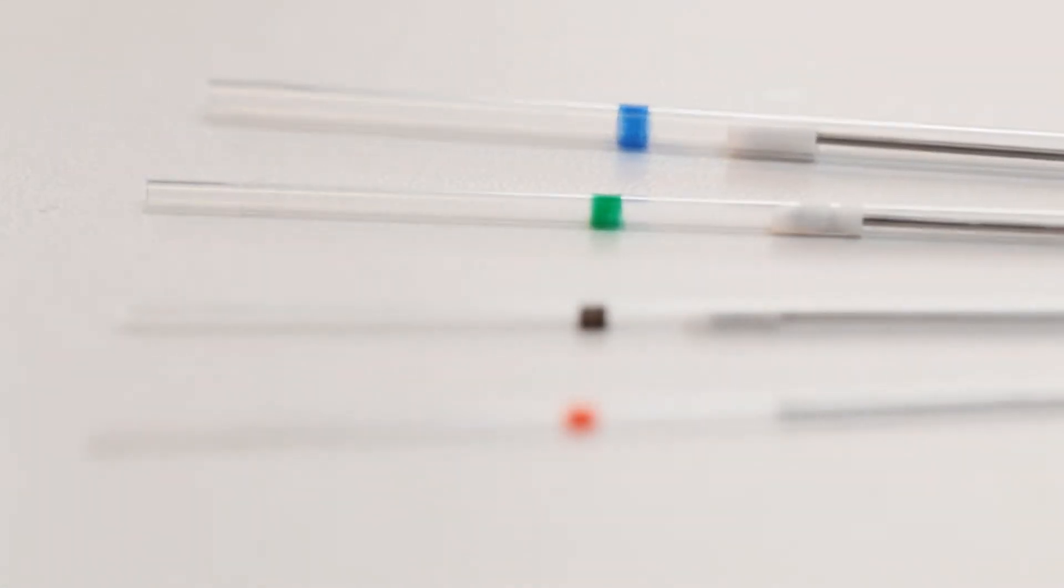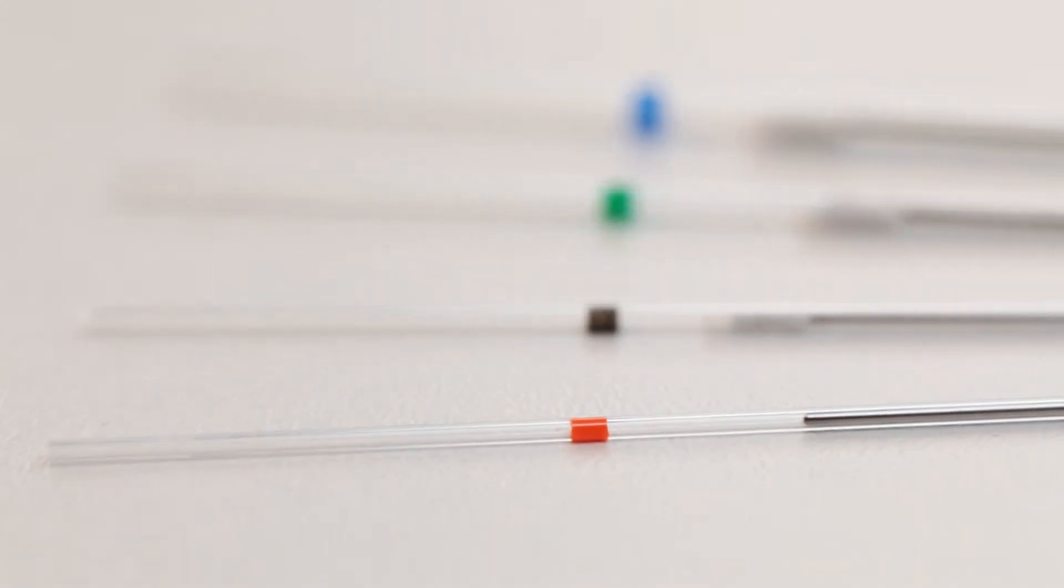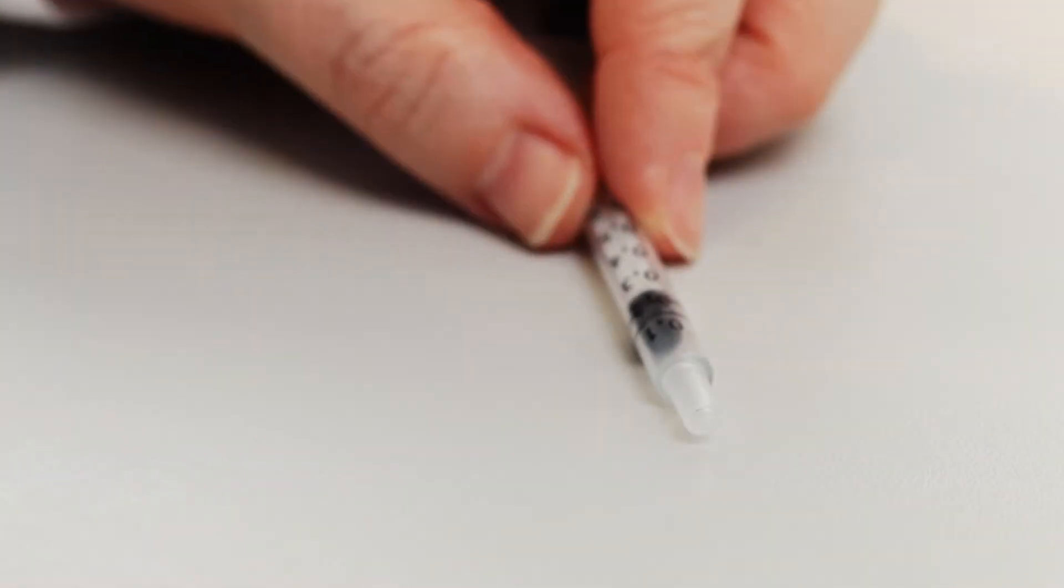Choose the right-sized embedding container. Capillaries from your Zeiss Starter Kit are color-coded according to their diameter, or just cut off the tip of a one milliliter syringe.